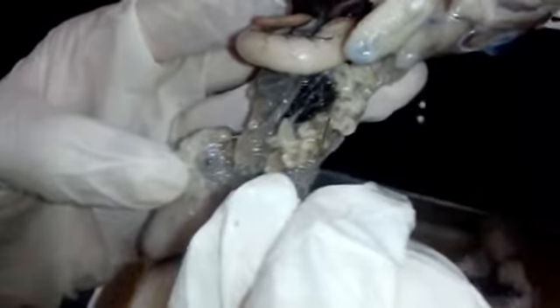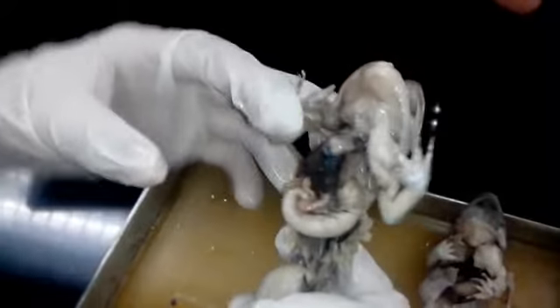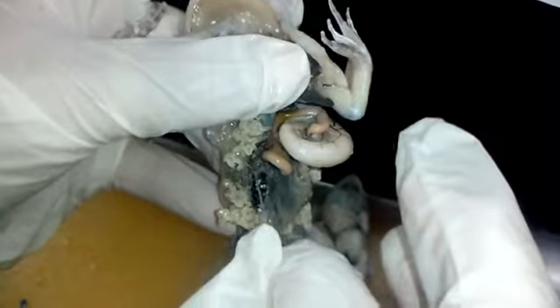The whitish straight line here is called the adrenal gland. In females, the reproductive organs are the ovaries, located here, which contain the matured eggs. The oviduct is the tube-like structure that serves as the passageway for egg cells.